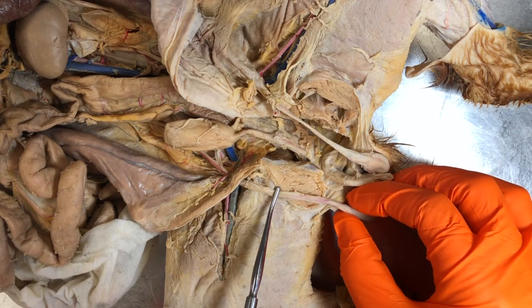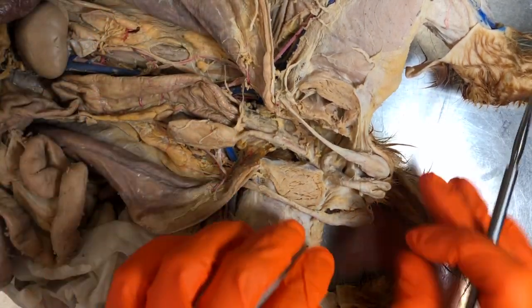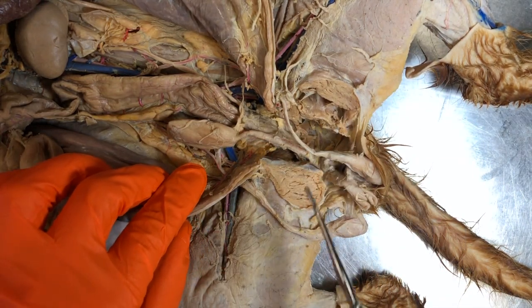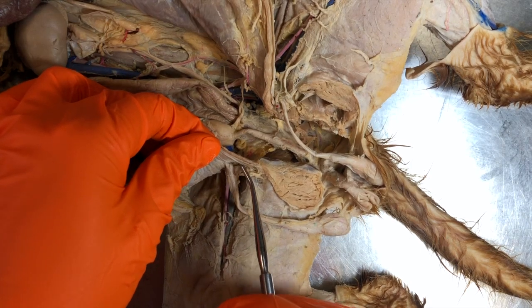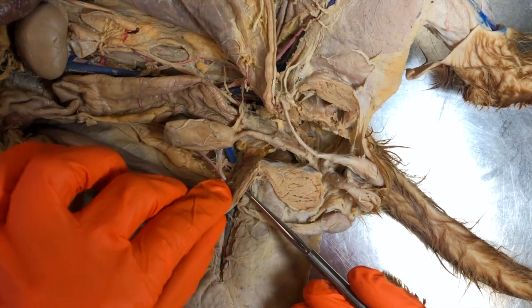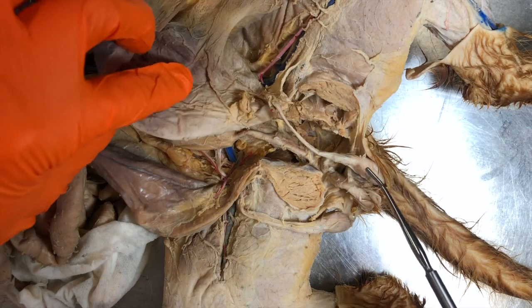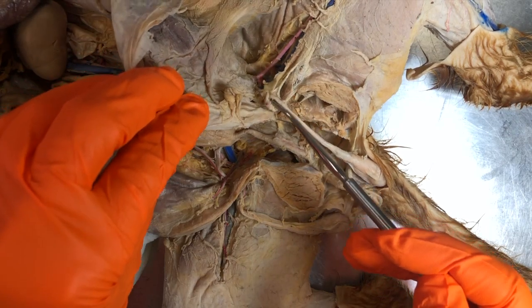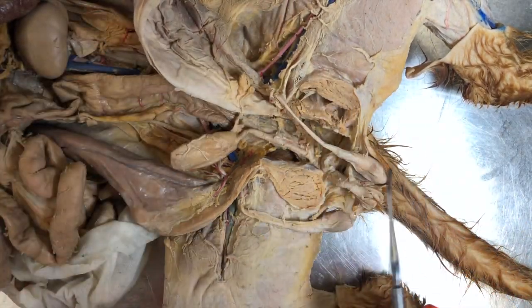The spermatic cord creates an opening into the abdominal wall. We have to make a connection from the external structures to the internal structures. The spermatic cord runs up and there is a little opening that goes into the abdominal wall — that is called the inguinal canal. There is one on the right side associated with the right testis and one on the left side associated with the left testis. That is how everything on the outside of the body connects to the structures within the abdominal cavity.